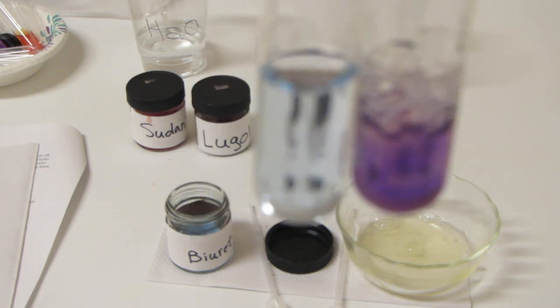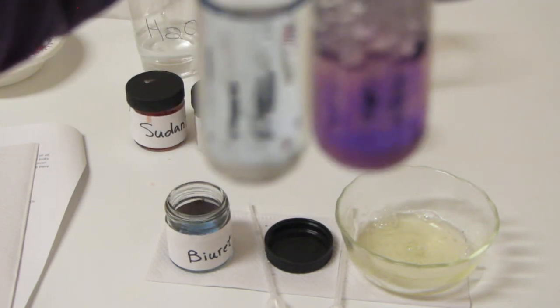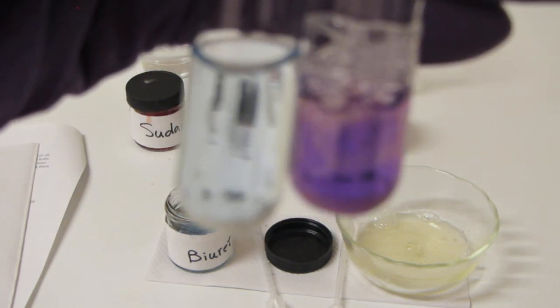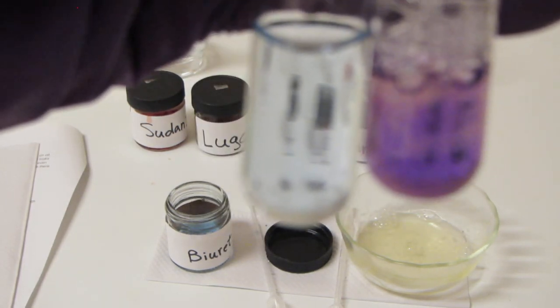All right, so there you go. And that is how we can identify proteins in a solution. So hope you like that. That's a pretty one. And we'll get ready for the next one, guys. Bye.